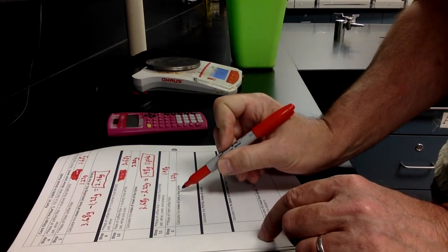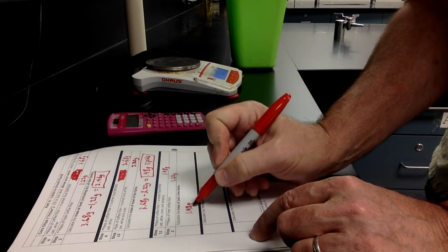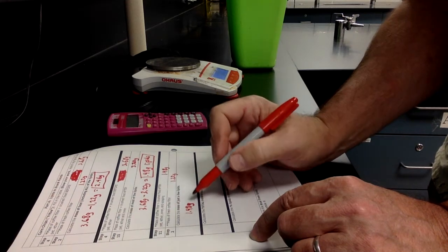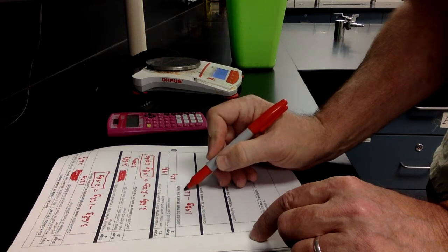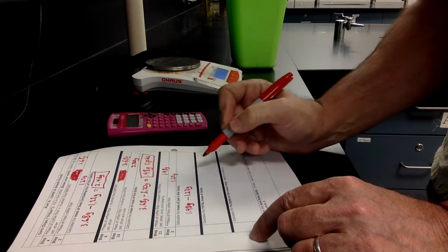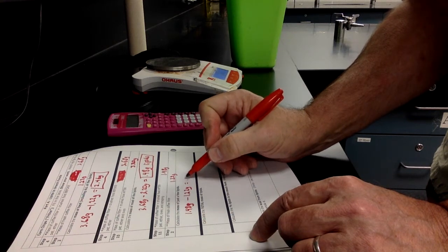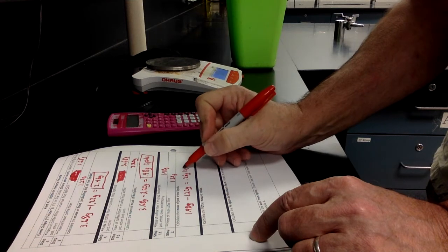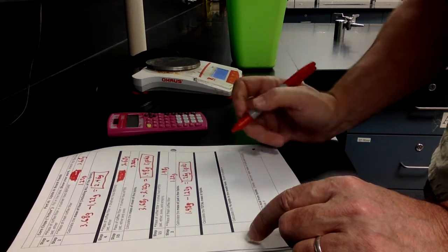Calculate the mass of just a few lipids. So after scraping the filter paper, it weighed 1.48 grams. The fresh filter paper, before we put it in contact with food, was 1.22 grams. So that's telling me that 0.26 grams of lipids are stuck to the filter paper because I scraped off all of the crumbs.